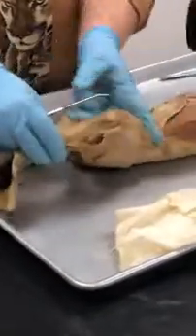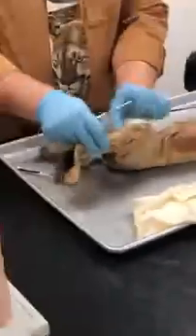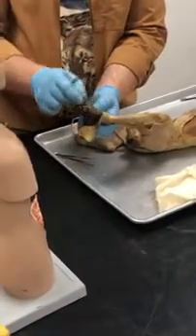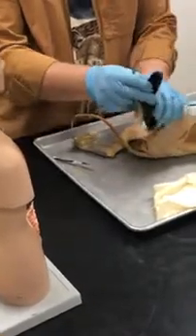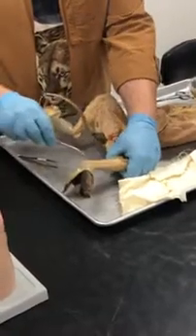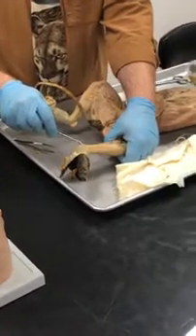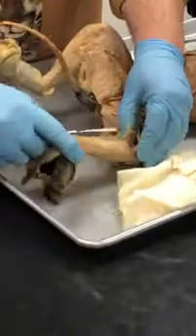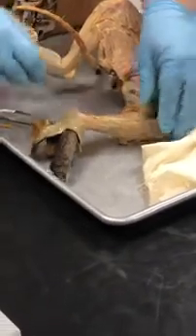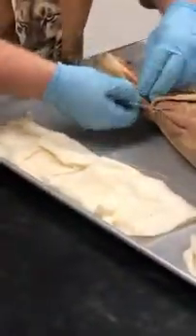Now, you got to visualize this too with a cat. Let me just get you oriented. This is the thigh of the cat. This is the lower leg of the cat. So that means this is the foot of the cat. It's got a long foot, but cats only walk on their paws, which means they're only walking on the tips of their toes. So the calcaneus is located here. Okay? This is the gastrocnemius, right? You learned about that from before. The calf muscle connects right over here. The calf muscle wouldn't be here, it's over here, because you got to understand the anatomy. Okay? All right, so let's look at the quadriceps of the cat. And it's pretty easy.